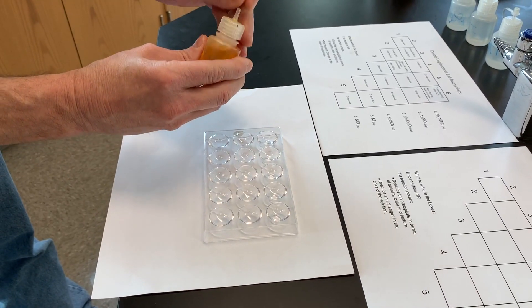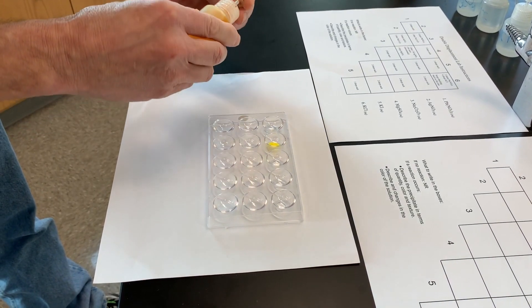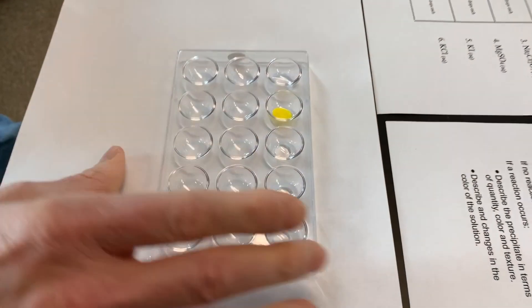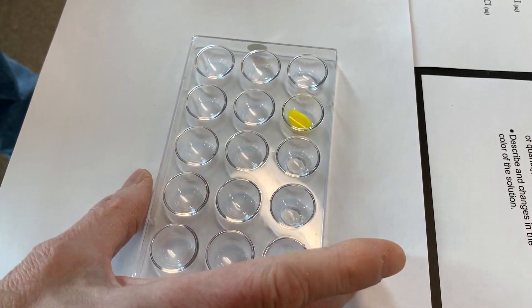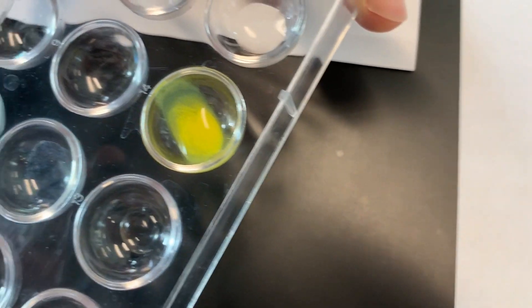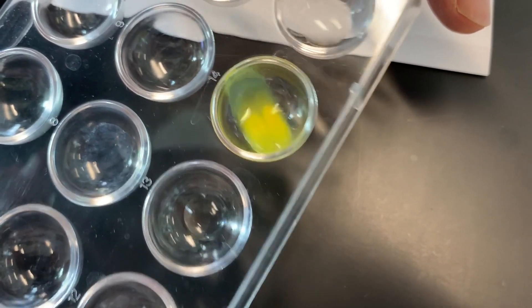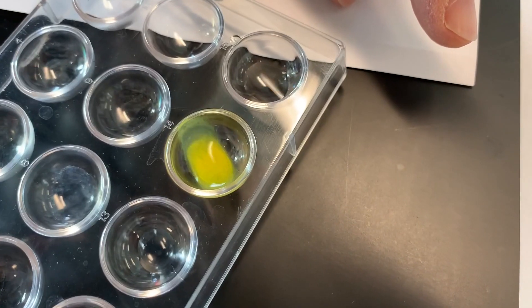Okay, I've got my sodium dichromate. I'll put one drop in. Now let's get close up to that and we'll see. After a little settling, you can see that what we have here is a yellow powder and the solution is colorless. We'll see that more and more as it settles.